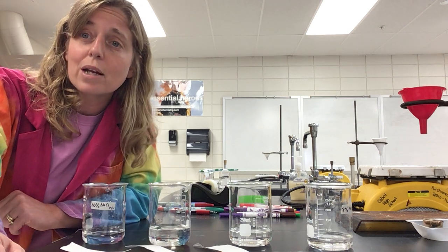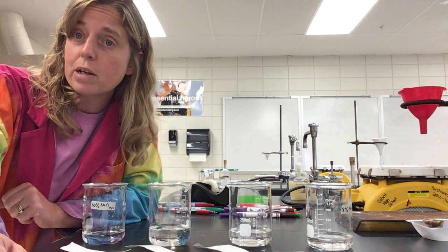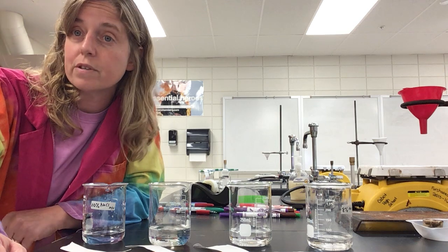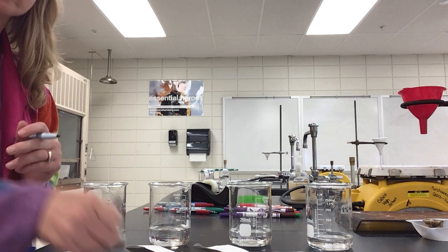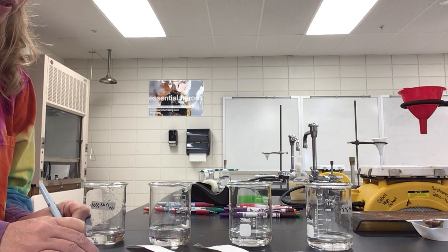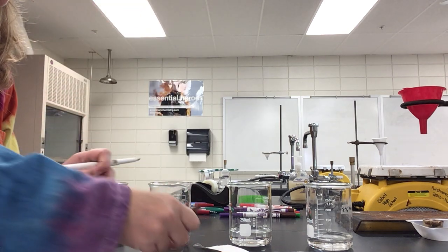So when these separate, you're actually going to see an interesting distinction between the same color but two different manufacturers. So we're going to do both brown and black and show you and compare the differences between Crayola and Vis-a-Vis, okay? So how you do this is you're going to take your paper like this, and you're going to go probably about 1 inch above, and you're going to put a really big thick line on there, and you're going to do that on every paper, okay?